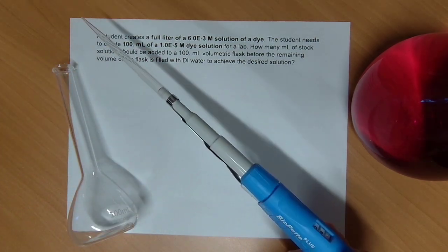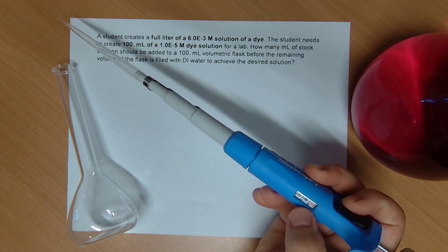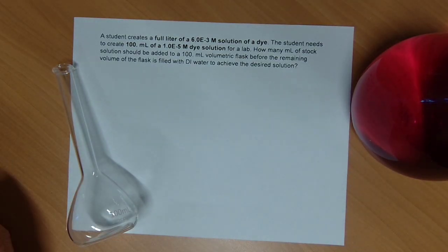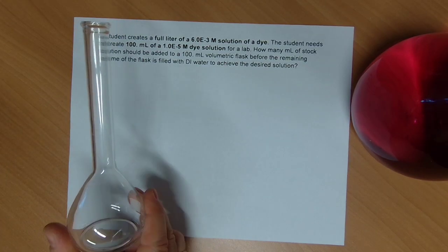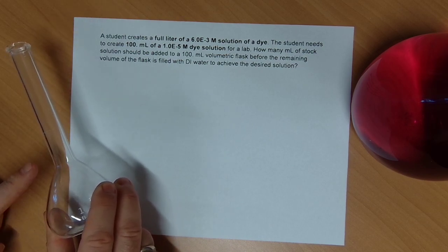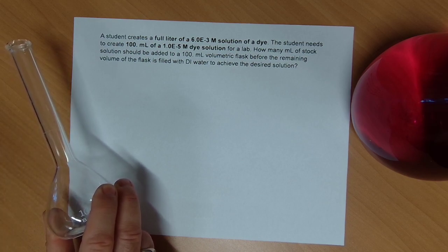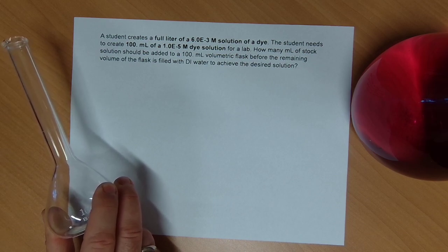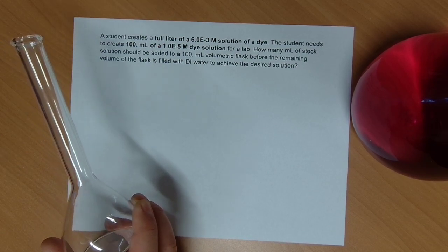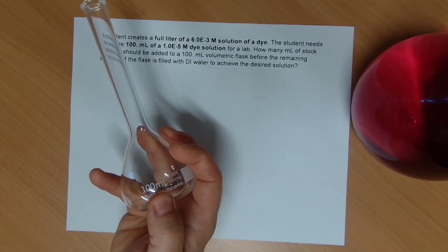And so I might use something like this pipette here. And I'll show you guys how to use these, but what you can do is you can dial in a certain volume that you want that I can draw out of my stock solution. And I would put that tiny volume into this volumetric flask here. And if I hold it over the table a little bit, you can see very gently an etched line there. Anything below that mark, to have it full below that mark means that you have precisely 100 milliliters in this particular volumetric flask here. So 100 milliliters.